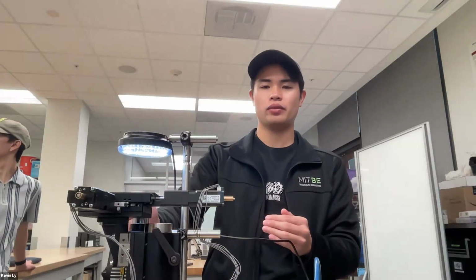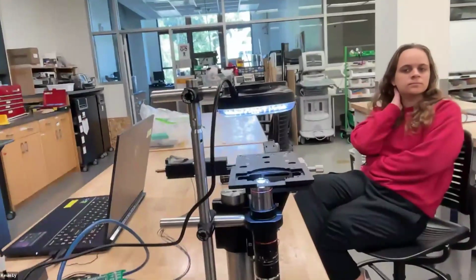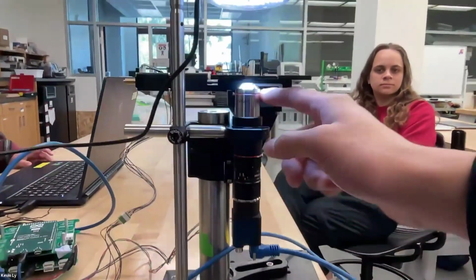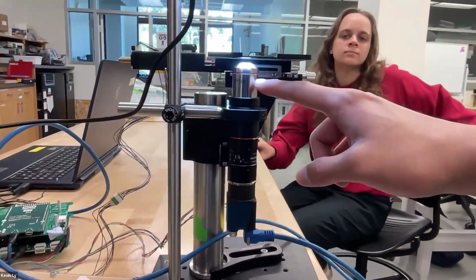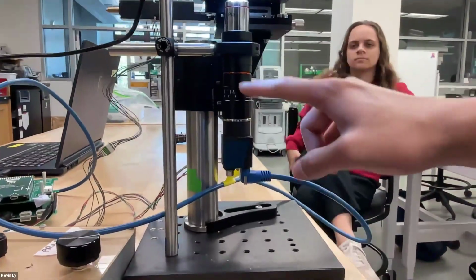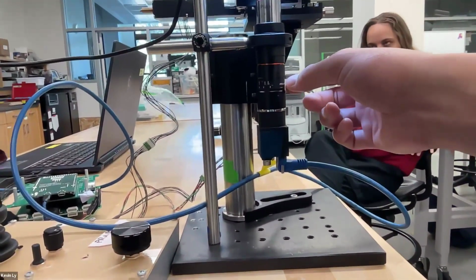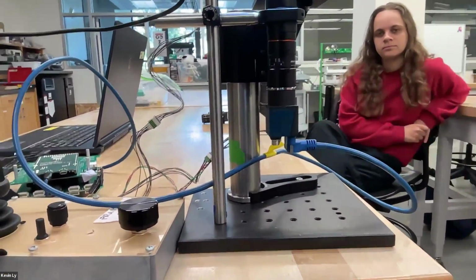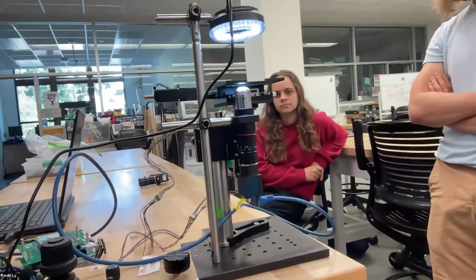So for example, here we have the objective lens, and the sample is going to sit on this stage. This is the objective lens. I know it looks pretty long and fancy, but you could essentially think of it as one lens that's going to make light parallel all the way in here, and it's going to hit a tube lens. There's a tube lens, right? And it's going to focus it on the center of the camera. So you might ask yourself, where does the magnification come in?